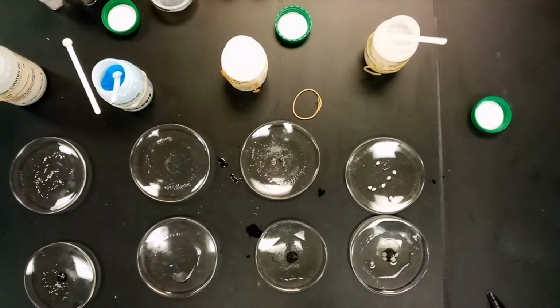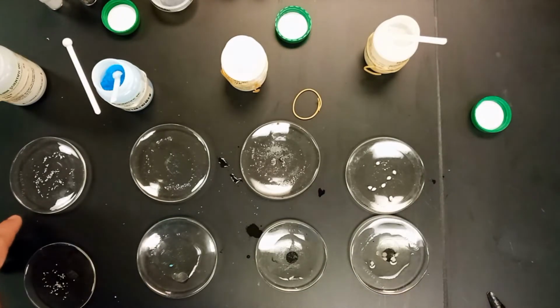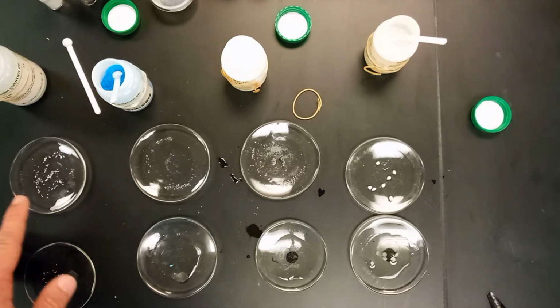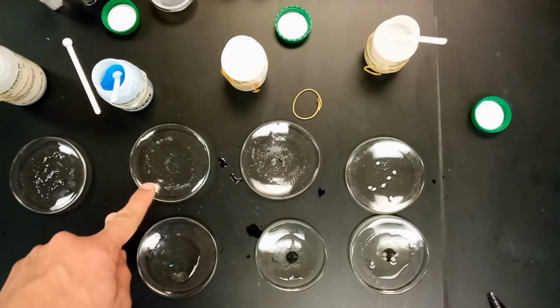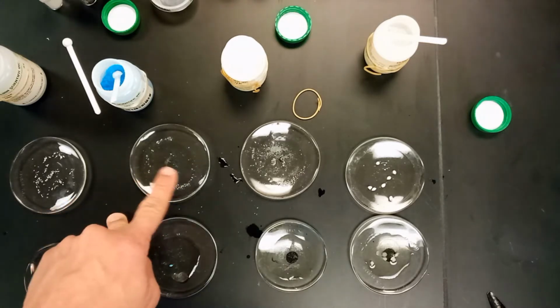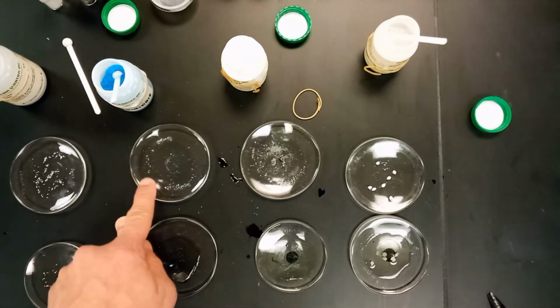All of our things set up. So we see here the zinc with the hexane looks the same as usual. The copper sulfate in the hexane also not dissolved at all, which is a little peculiar because we know that it dissolves in water, but not in hexane.